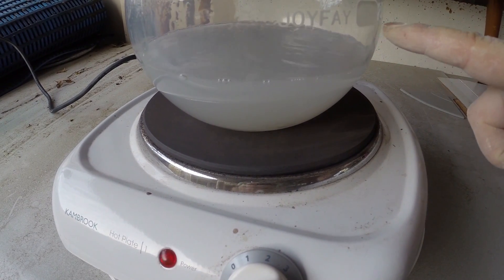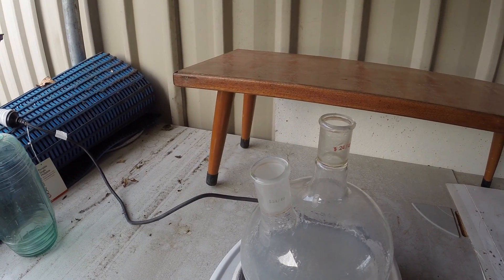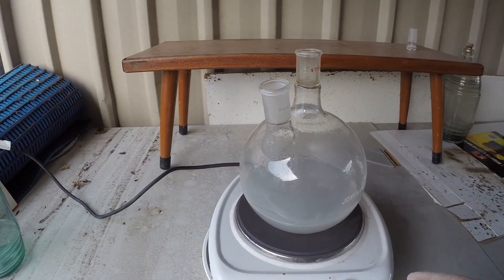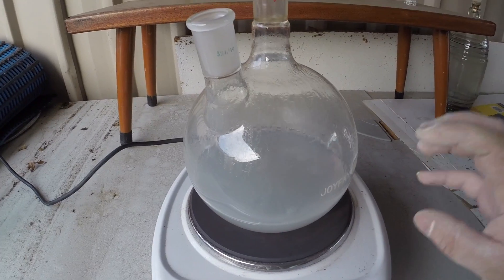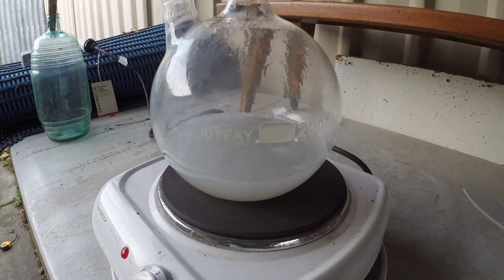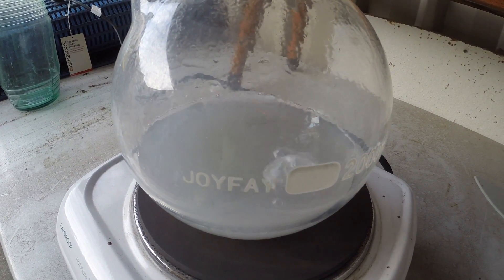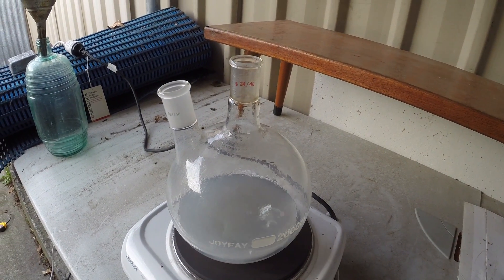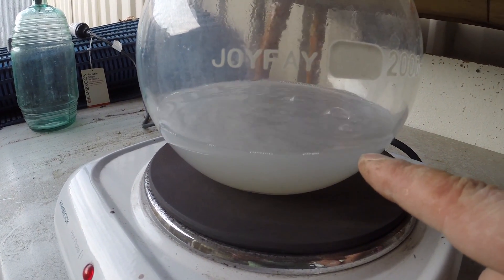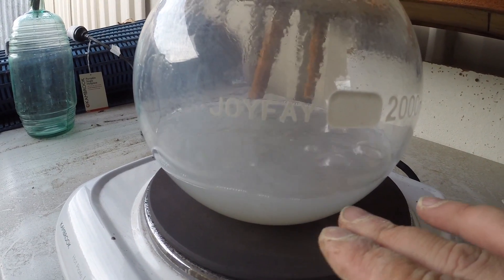The level was up about there before from memory — we've done quite a bit and got it down quite low, so we just need to keep an eye on it. Once that steam vapor turns into a thick white cloud, we've started vaporizing the sulfuric acid and we want to stay well away from it, turn it off, and let it cool down. That'll mean we've reached such a concentration that that's all we need and we can bottle it up. After a bit more boiling, we've come all the way down from up there, so we're close to an optimal concentration versus our health — just need to come down a little bit more.